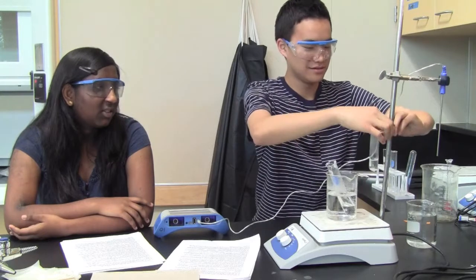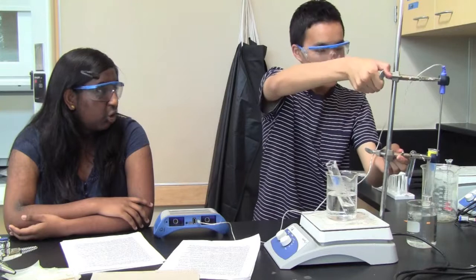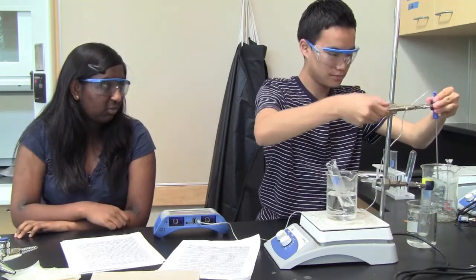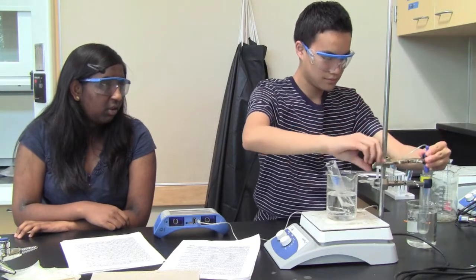Okay, so then you have to talk about HCl. Immersing the solution now. How about one person does the moving and showing? Okay, you want to put this in first. So we talk about HCl, you show this. Start the data collection. Remember, you want to gently stir the solution. Make sure you start the data collection, because if you don't, this would be a big waste of time.